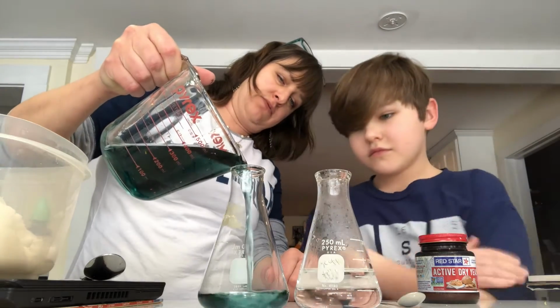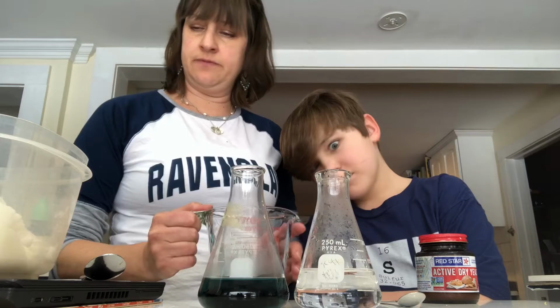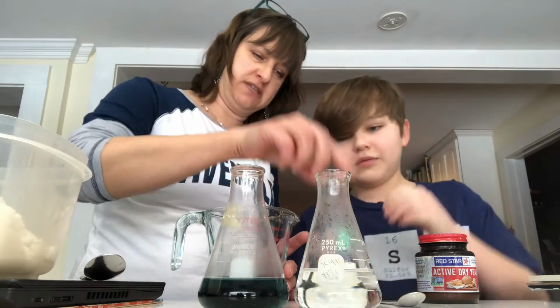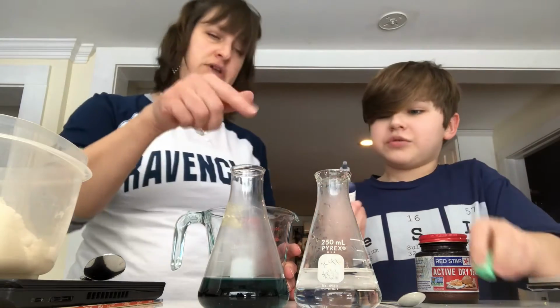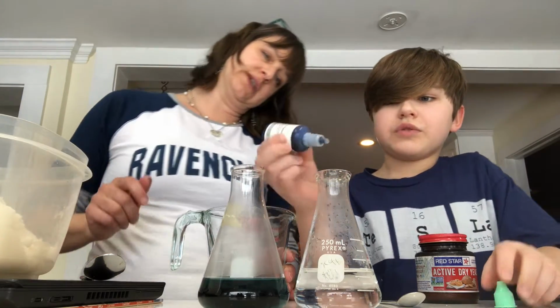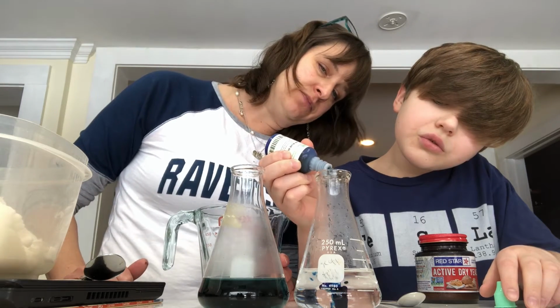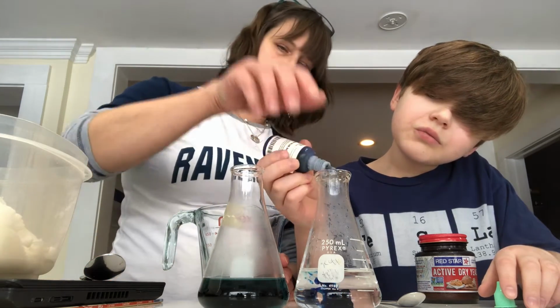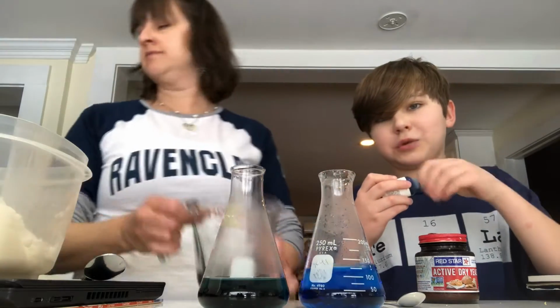So I'm gonna pour that right in here. This water, put a few drops of this. This is the methylene blue. So bromothymol blue, methylene blue. 3-4 drops. Let's see what it looks like. Now notice we're not really measuring. You don't have to. 2, 3. That's good. Cool. Let's get it swirling. All right. I like that color.